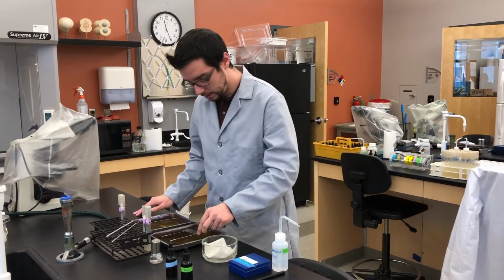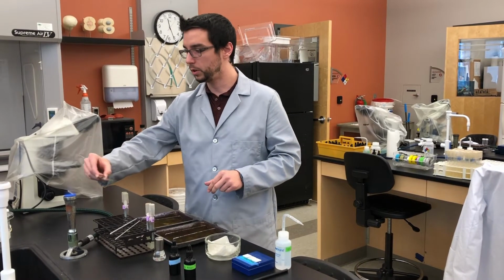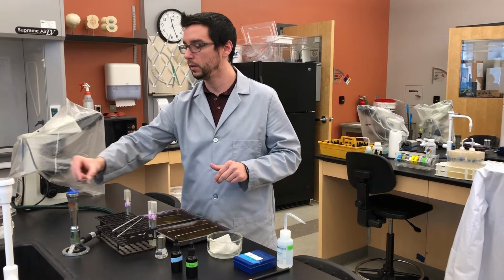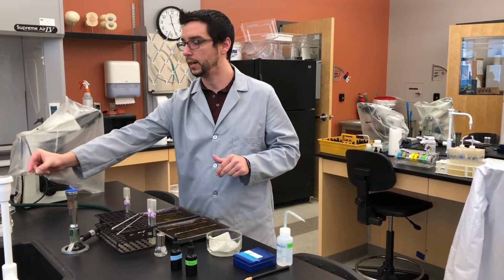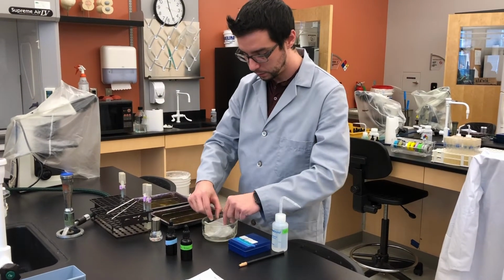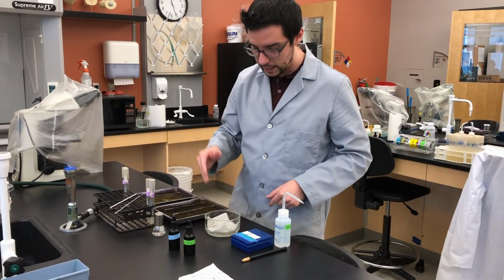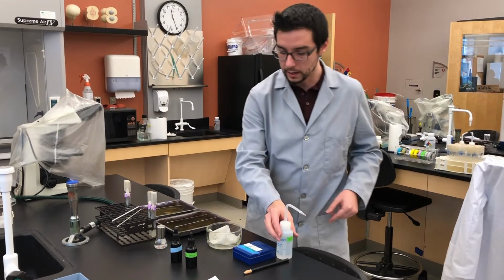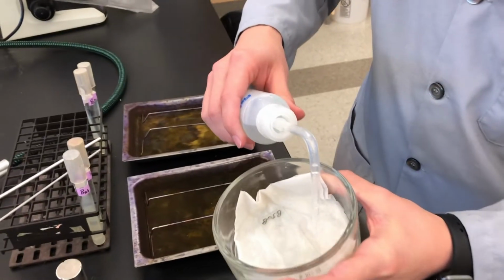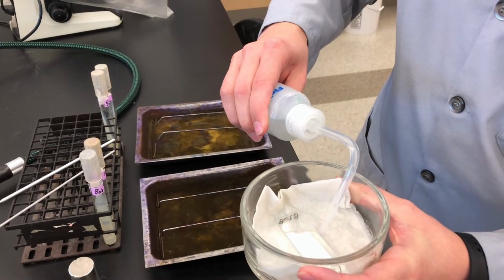So, this is now air dried. Be careful not to burn yourself. Pass it over. 1, 2, 3, 4, 5. And then once heat fixed, simply set it down into your bowl, and you want even distribution of heat with your slide. So the critical thing is to make sure you come in and fill in underneath the slide with water.